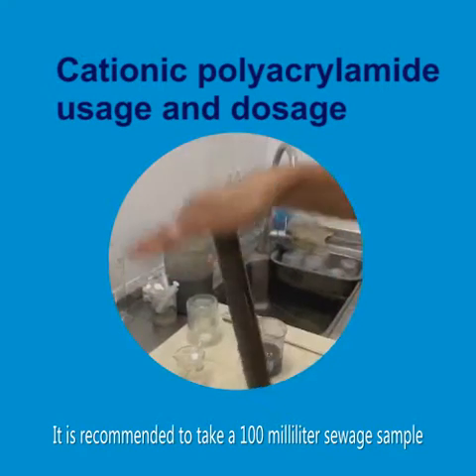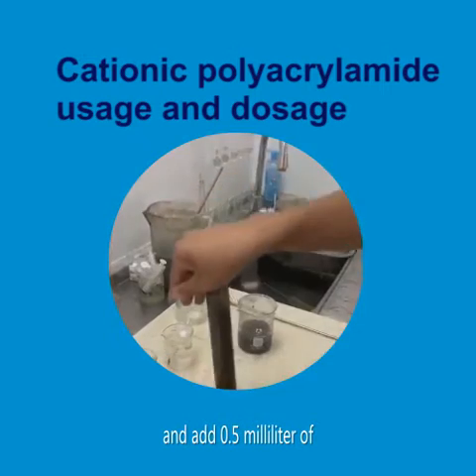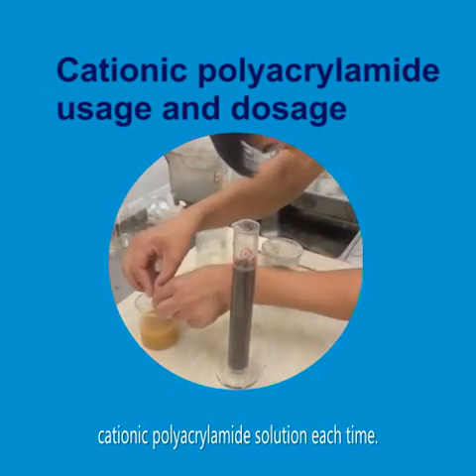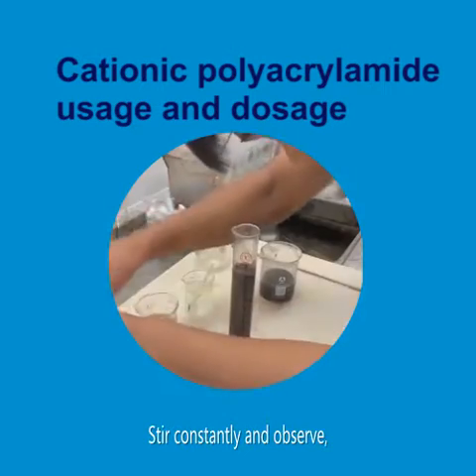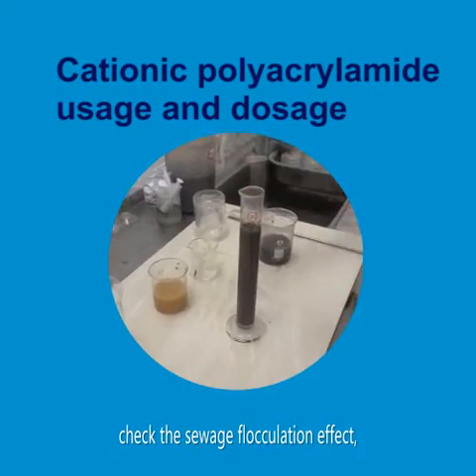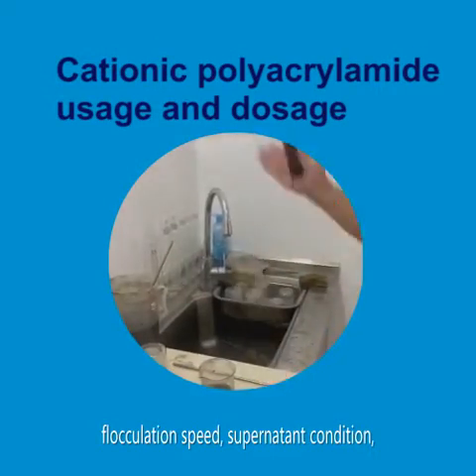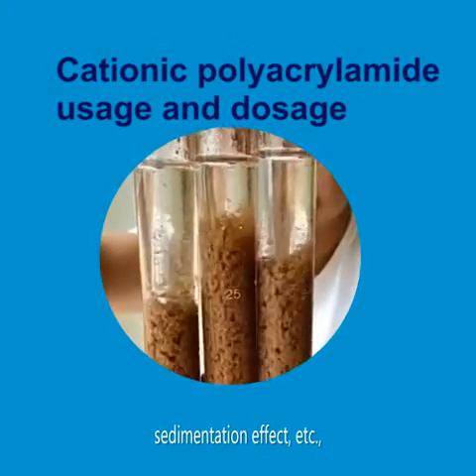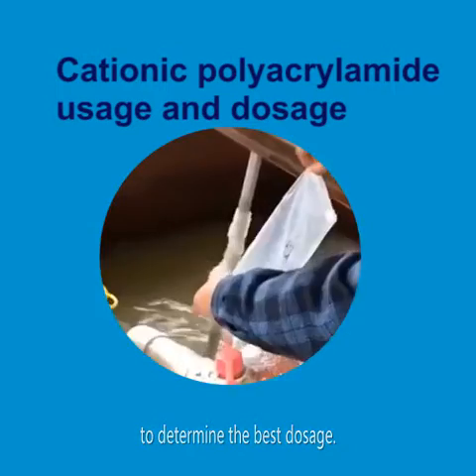Add 0.5 milliliters of cationic polyacrylamide solution each time, stir constantly, and observe. Check the sewage flocculation effect, flocculation speed, supernatant condition, sedimentation effect, etc., to determine the best dosage.